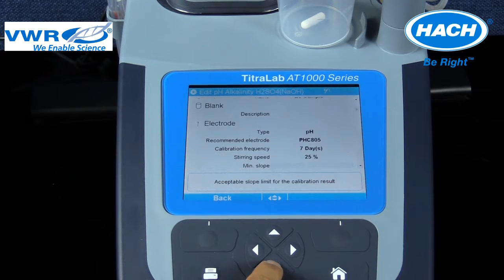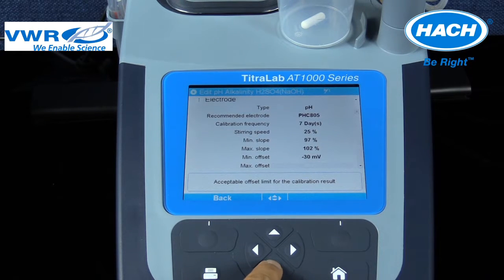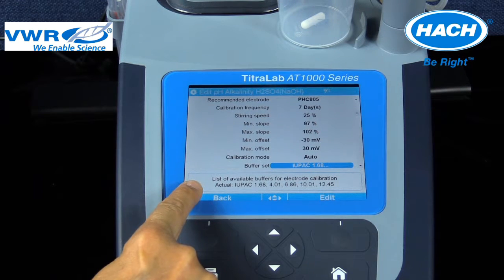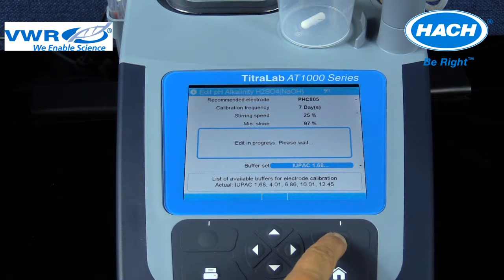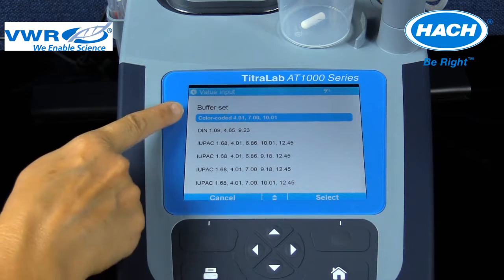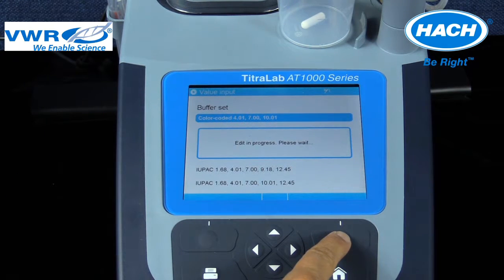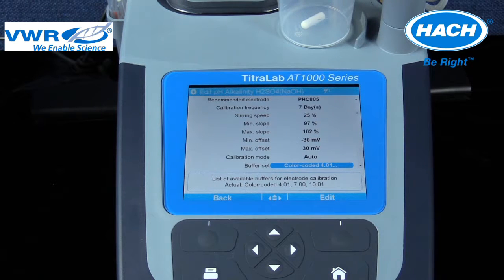The criteria for calibration frequency, slope, offset, calibration mode, and buffer sets are available in this menu. By selecting buffer set and Edit, other pH buffer solutions can be used to calibrate the connected pH electrode. In this case, the color coded pH buffer set has been chosen. The software will display that the changes were made.